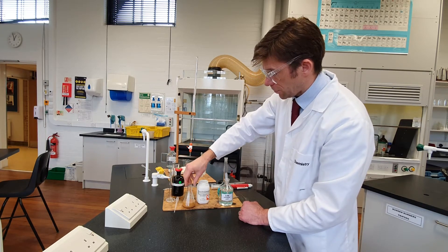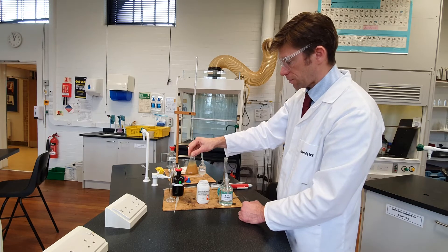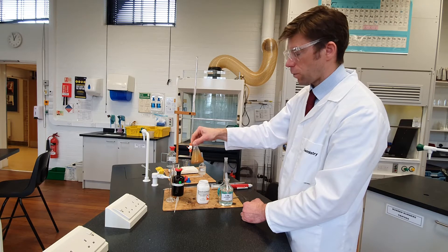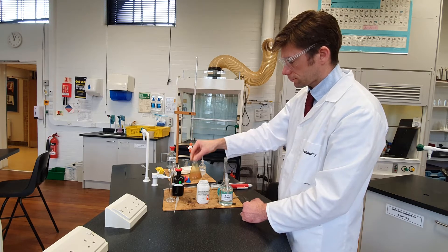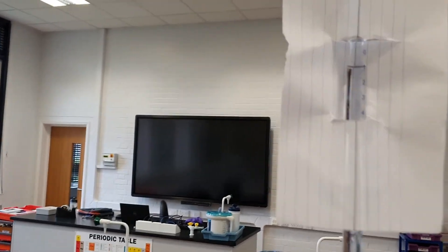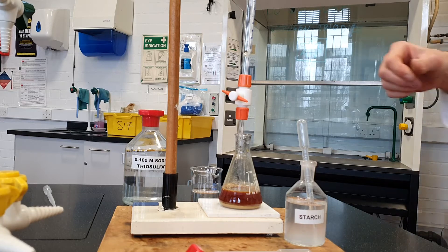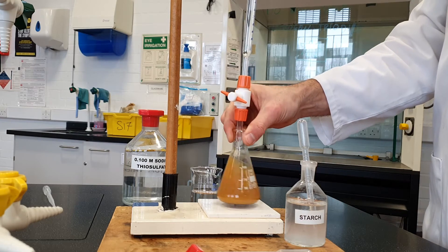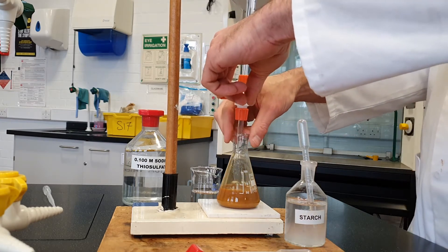The copper ions are going to be reduced. The iodide ions will be oxidised back to liberated iodine, so we get this brown colour and also a white precipitate forming. Now we need to take the initial burette reading. Using a piece of paper can help spot the level of the burette. You can see the precipitate has settled a little bit — the orange-brown solution with the white precipitate gives it its cloudiness.